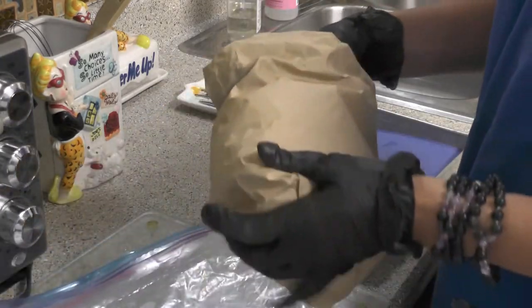Off to the kitchen to dissect an eyeball. I kind of feel bad that you don't get to dissect an eyeball from your kitchen — the eyeball dissection is the coolest dissection of the semester, maybe both semesters. If you ever get the chance to cut open an eyeball, take it. If you know somebody who's a hunter and they shoot a deer, ask them to keep the eyeballs for you, or order a lab kit and teach yourself a lab at home.